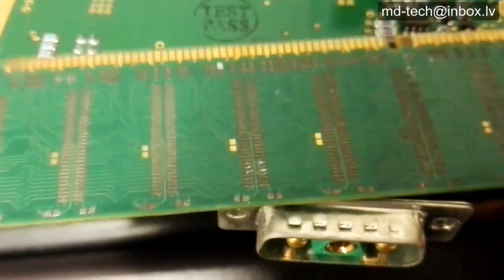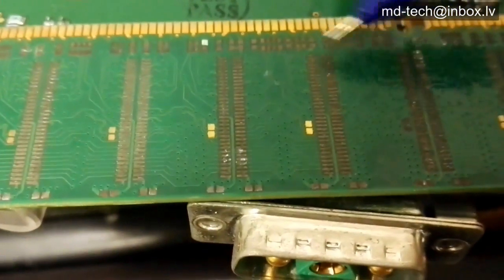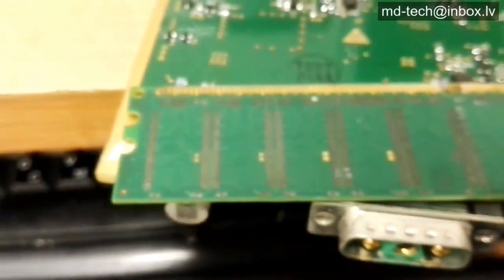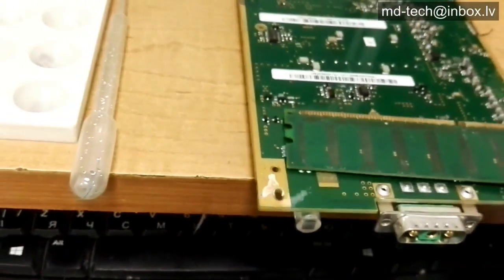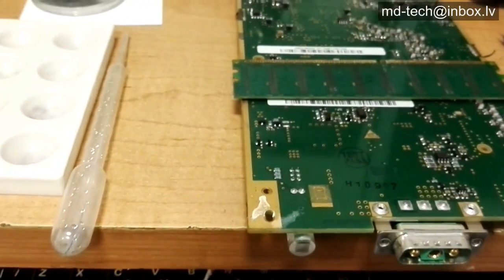These nickel pads contain a palladium layer and gold. Palladium is needed to make adhesion between nickel and gold. After gold pads are soldered, only palladium remains. If palladium is not plated, after soldering, solder balling and black pad problems occur.